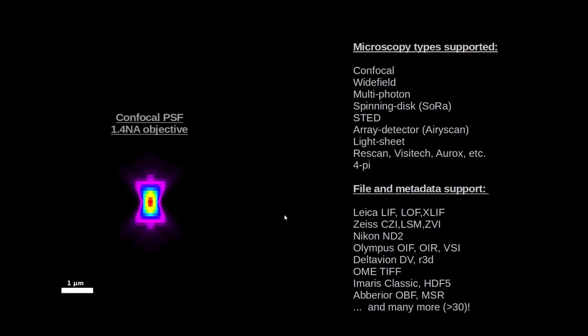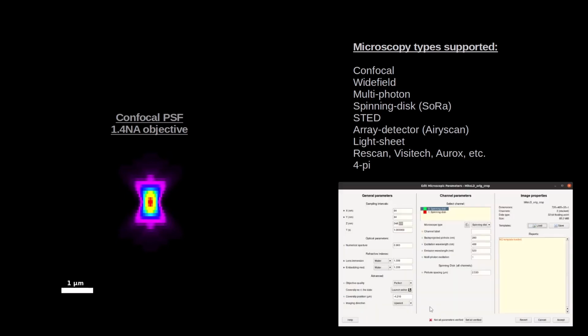Then there are point spread functions for every different microscope type. Every microscope type has its own point spread function, and we support all these systems, so almost any microscope. The files that are saved often include the metadata, and we read the metadata from many different files in our microscopy parameter editor, where you can edit and optimize them further. This allows us to create an optimal point spread function model.